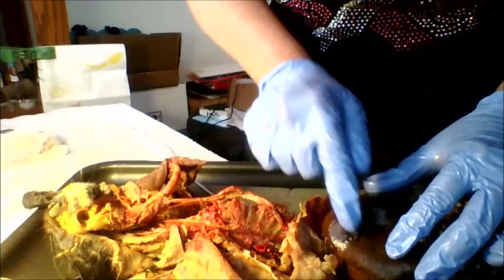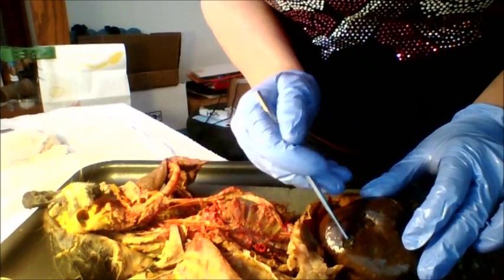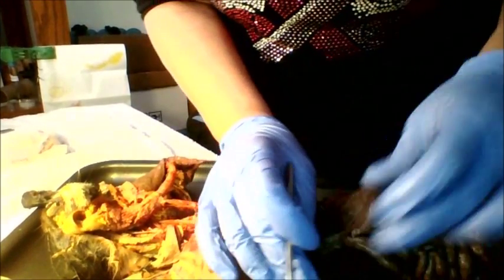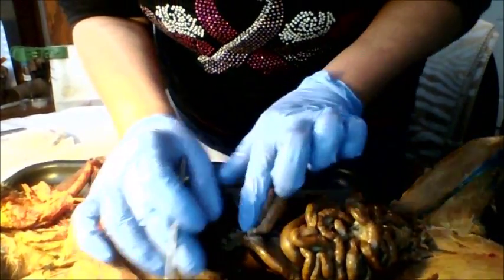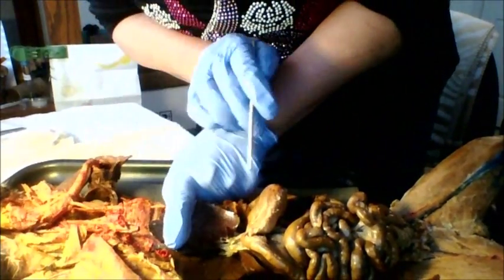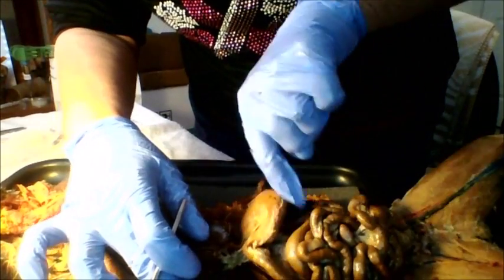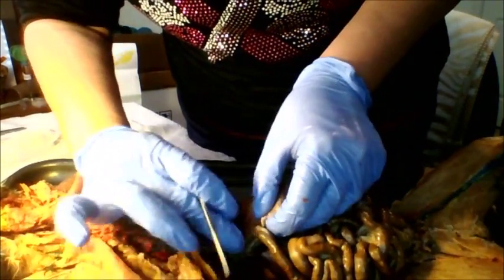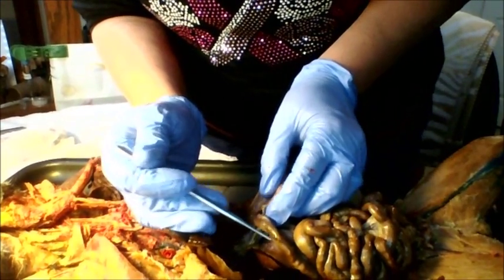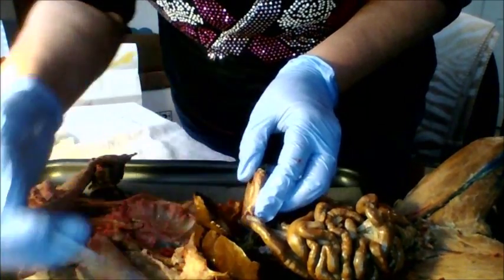Here's our liver. And just point out real quick, this is the gallbladder. On the cat, it's a little bit mushy, but it's right on top. If we pull the liver out of the way, you can see the stomach. And the stomach is C-shaped. The inside of the stomach here, or the inner curve of the stomach. And this area right here where the stomach empties into the small intestine, this is the duodenum.